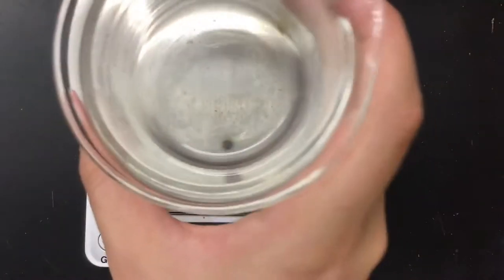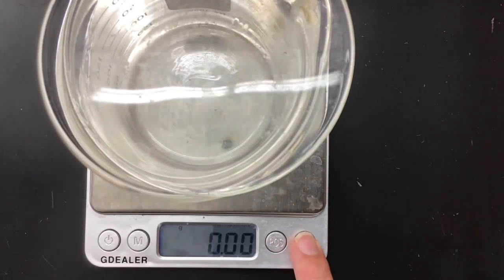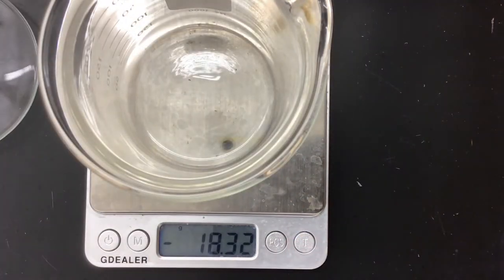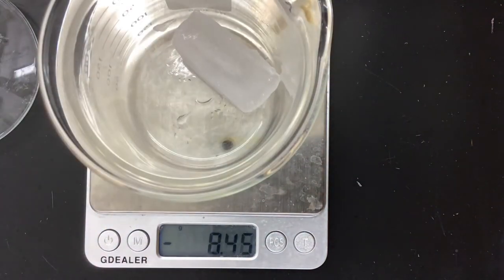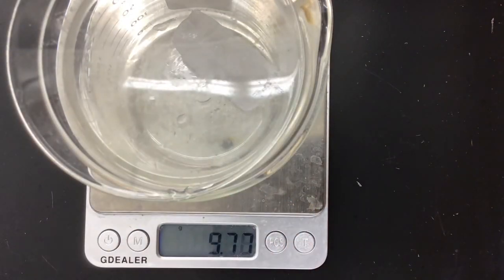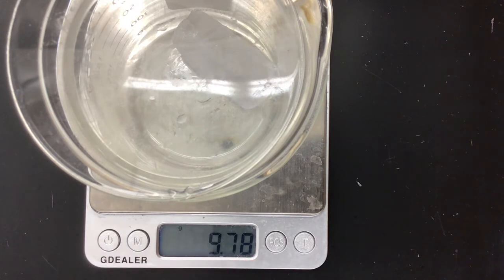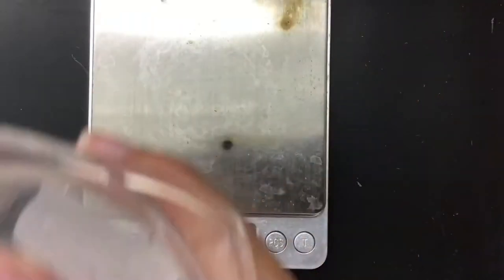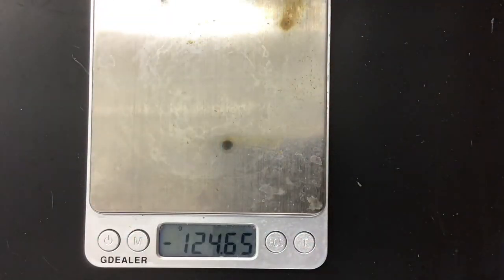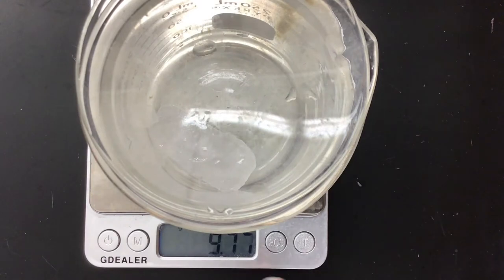This next station, we are going to be melting a piece of ice and watching the mass change. I need to get everything ready. I add the piece of ice, find the beaker, and find the mass of my ice. I am going to speed up the process by adding heat to our beaker. We will come back and check this ice at the end.